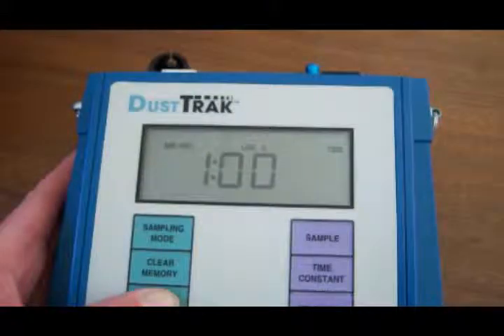While you're in manual mode, press and hold the logging interval button. This button changes the interval at which the instrument records a data point. By holding the button, the screen will display the choices you have for interval, starting with 1 second and going all the way up to 30 minutes. It is generally useful to set it for 1 minute, meaning the instrument records a data point every minute, and this point is an average over those 60 seconds.